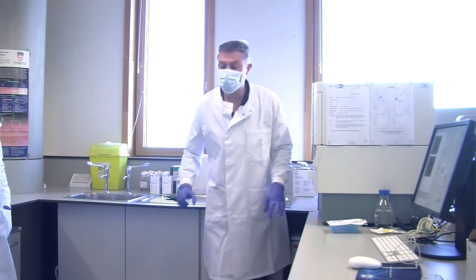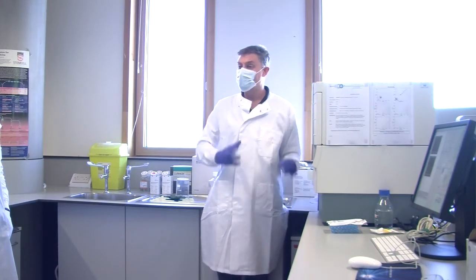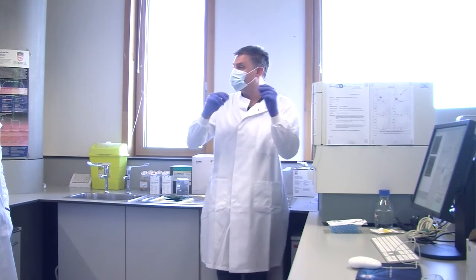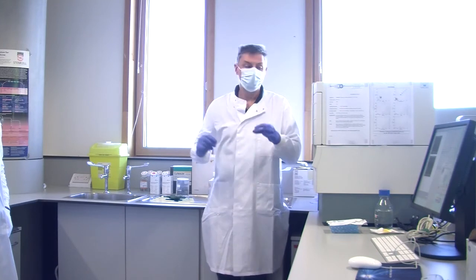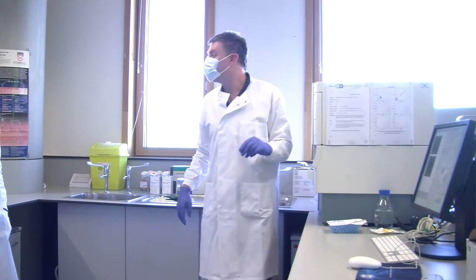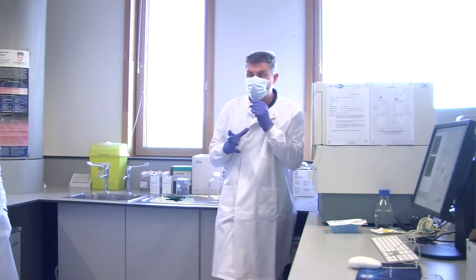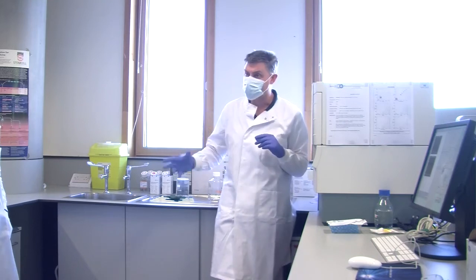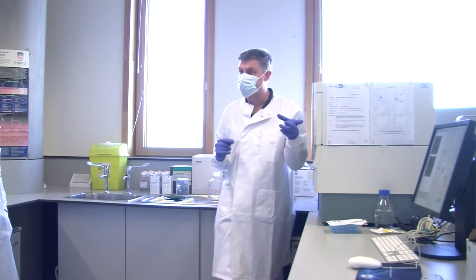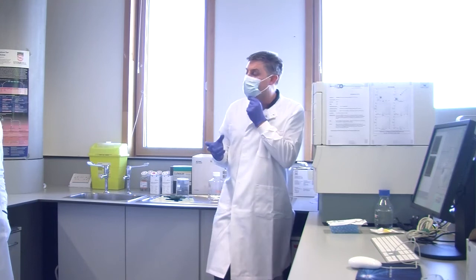Now we are getting a little bit of fluorescence coming through. This could be what's called carryover. I ran some beads before, and if some of the beads stick slightly on the inside of the tube, they will come through. Now we're only seeing one every few seconds. If you were running your cells, with 300 or 400 cells per second coming through, and you get one carryover bead every 3 seconds, it's only going to be 1 in 1,000. It's not going to make any difference to your data.